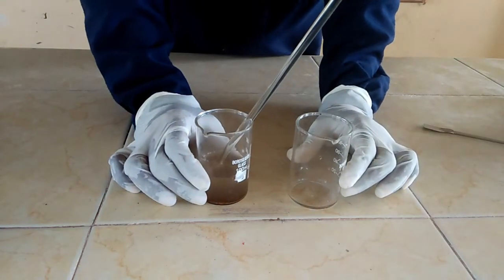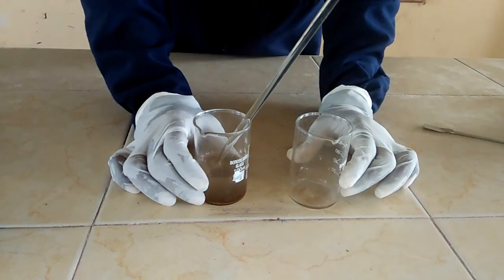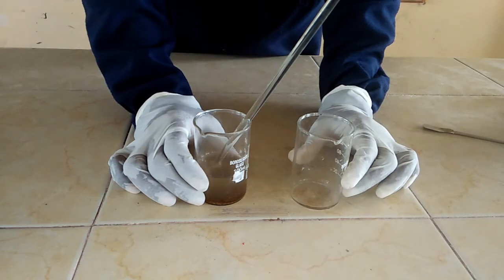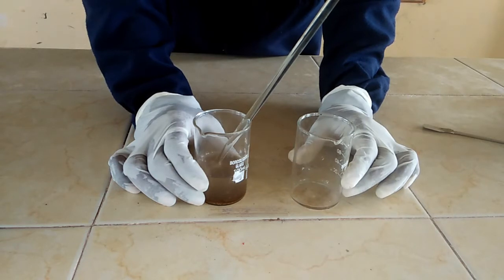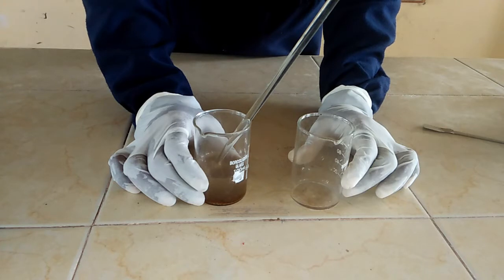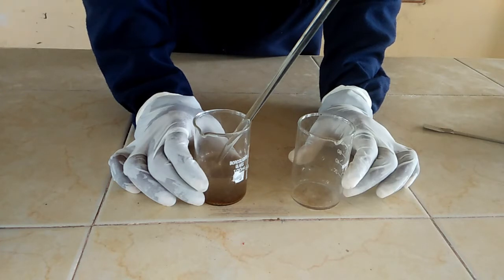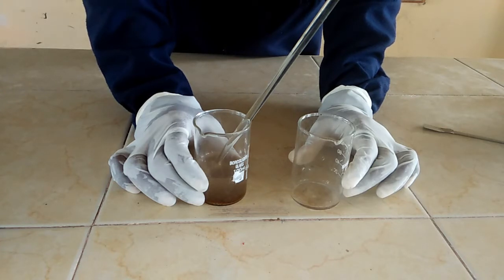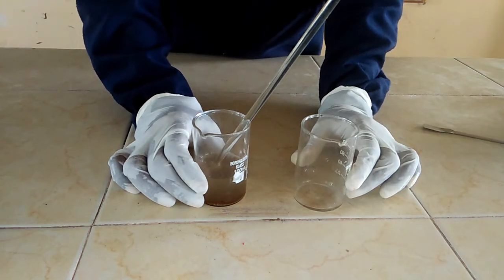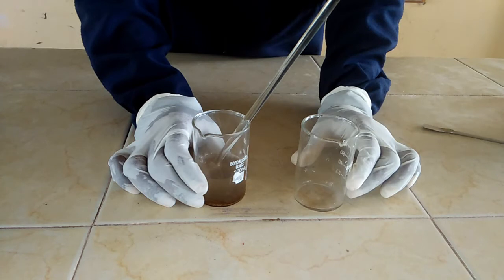How are you? I would like to explain how I can separate a mixture of insoluble solid-liquid mixture. An insoluble solid-liquid mixture is a situation where we have a solid that does not dissolve in the liquid.